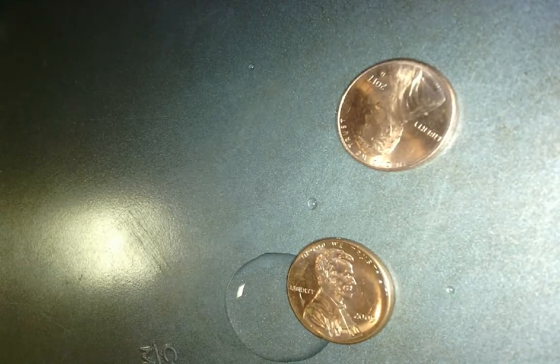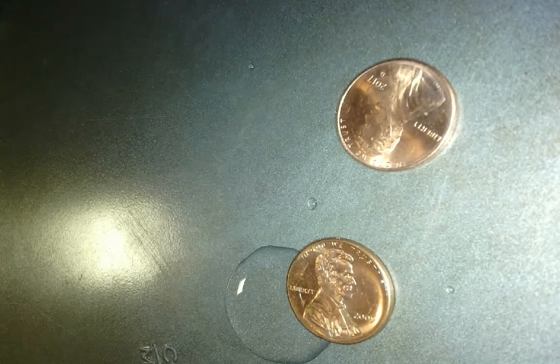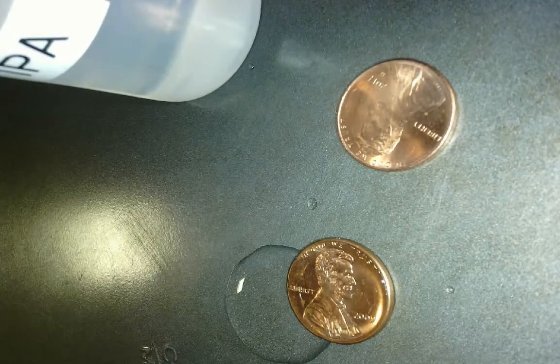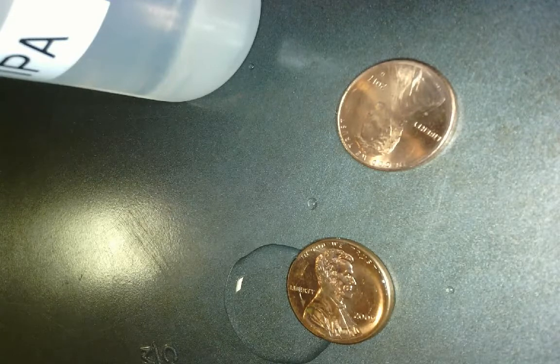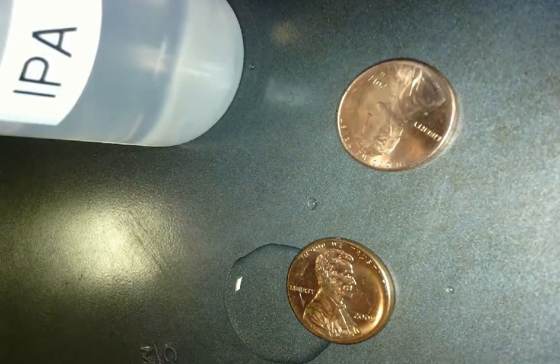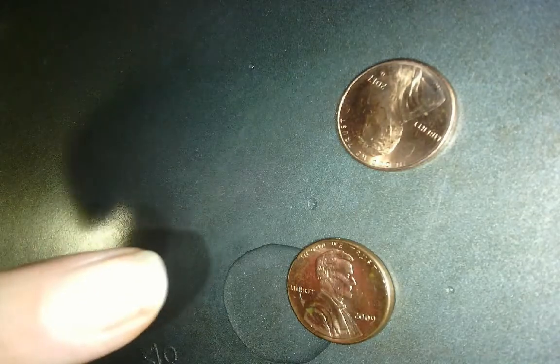So it held about 24 drops, and that's because these water molecules cling very tightly due to their hydrogen bonding, which is a really strong intermolecular force. Now I also have here isopropyl alcohol, which has hydrogen bonding too, but it only has 1 spot for hydrogen bonding because there's only 1 hydrogen bonded to an oxygen, where in water there's 2 hydrogens bonded to an oxygen. So we should see a lower intermolecular force. And if we're talking about our surface tension, that means we should have a lower surface tension because they're not attracted as well. So we got 24 water on the penny.